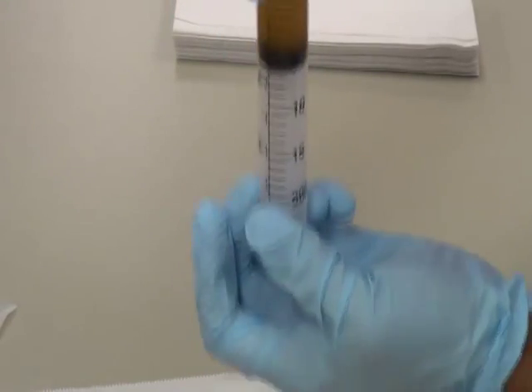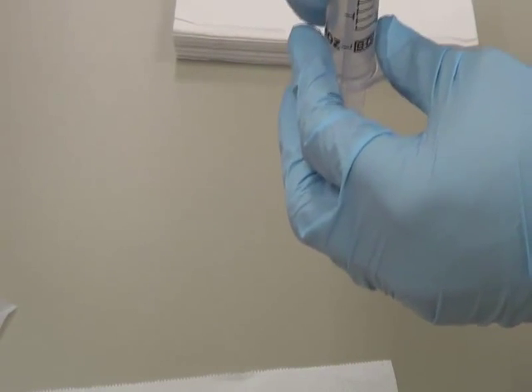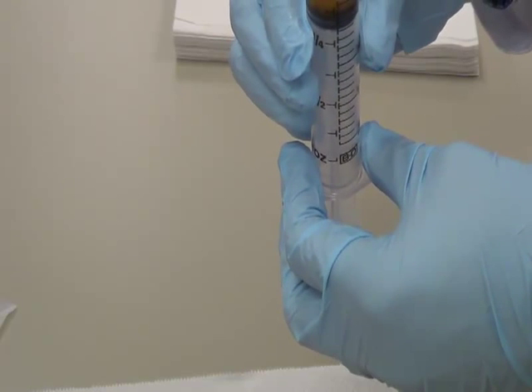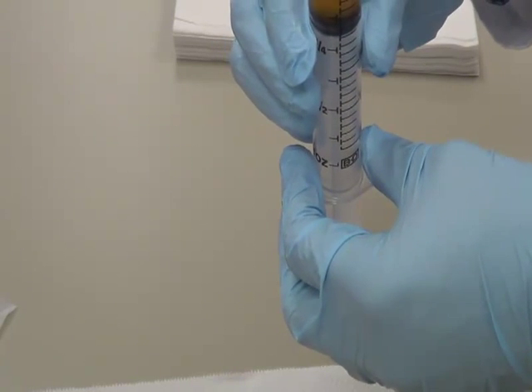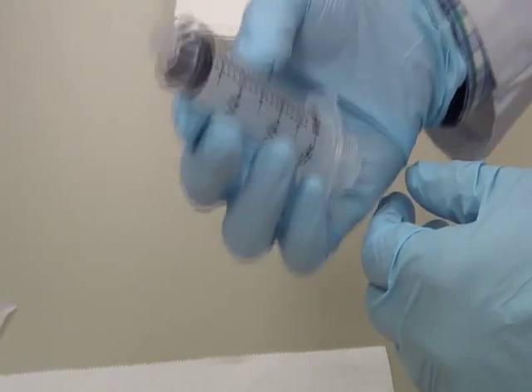Now I am closing my first syringe with this Luer tip. So I have approximately 5.4 ml in this syringe. So how much ml do I need to QS to 20 ml? I need around 14.5 ml.